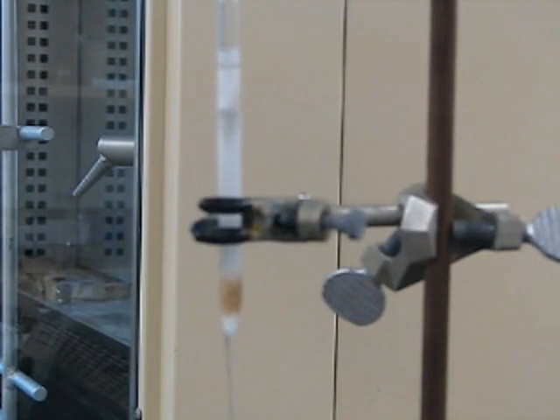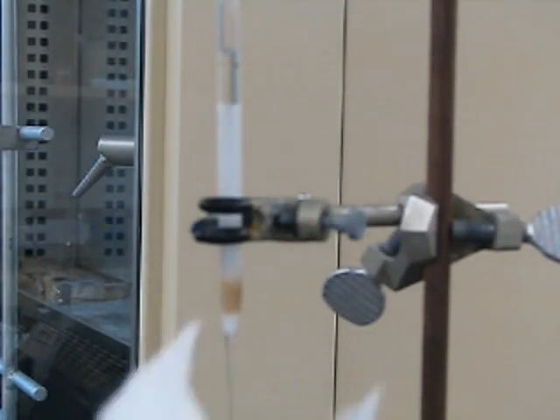So you knock the silica gel down in, and if you need to, add a little more solvent. You still want to leave maybe about an inch at the top of the pipette column before the... Or when you've added all your silica, there should be at least an inch left of clearance, I would say.